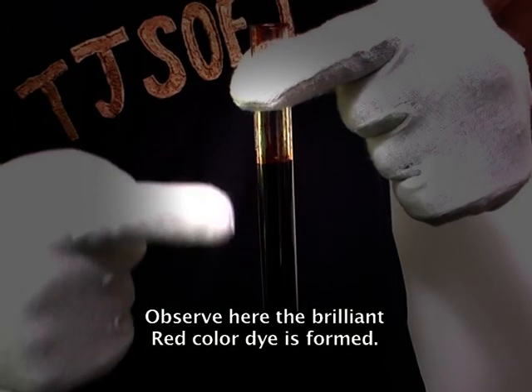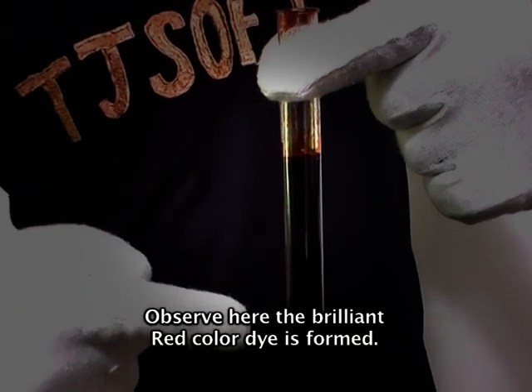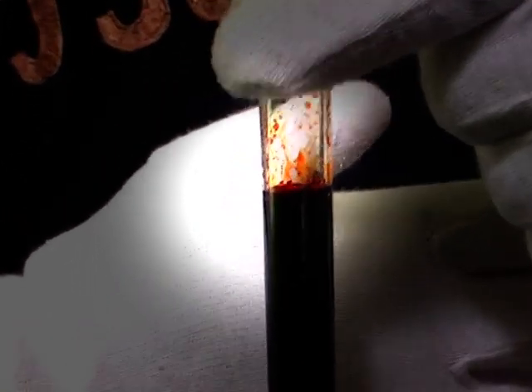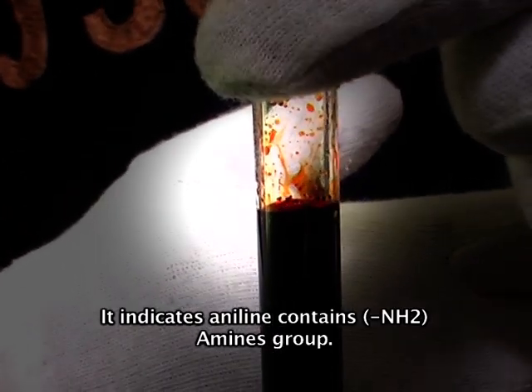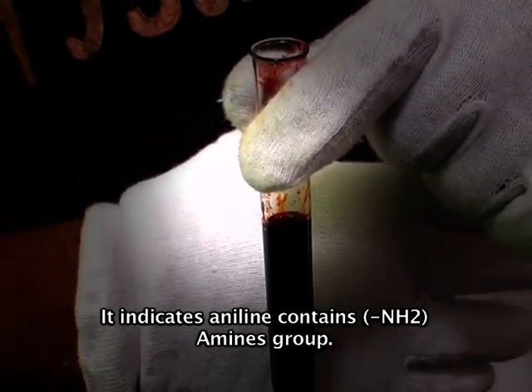Observe here — a brilliant red color dye is formed. It indicates aniline contains an amine group.